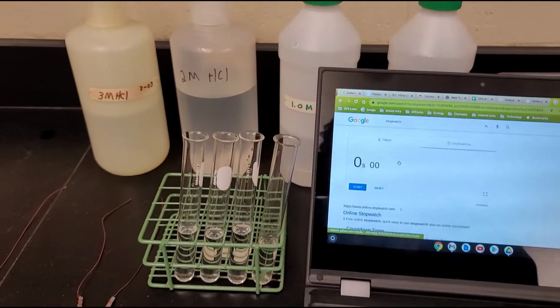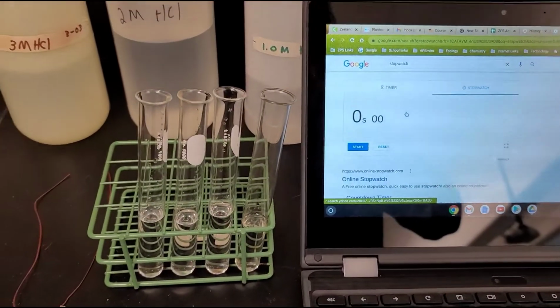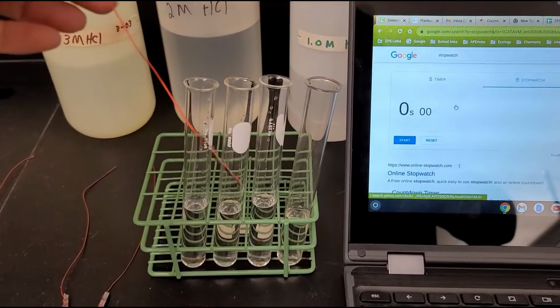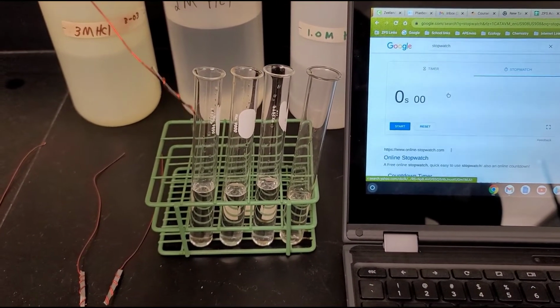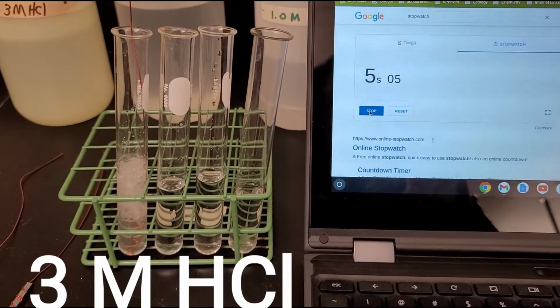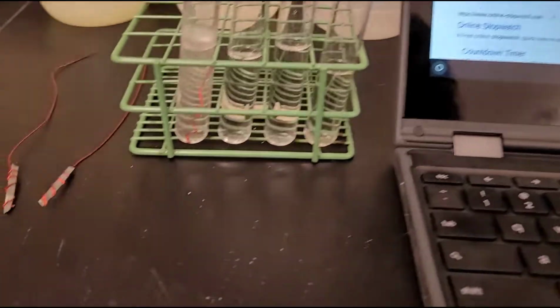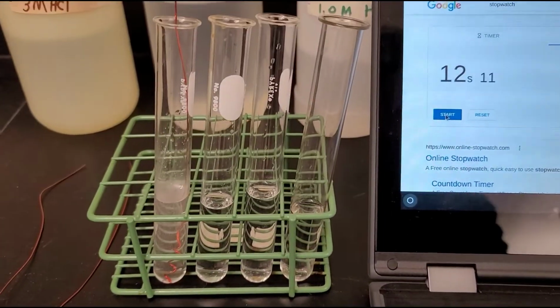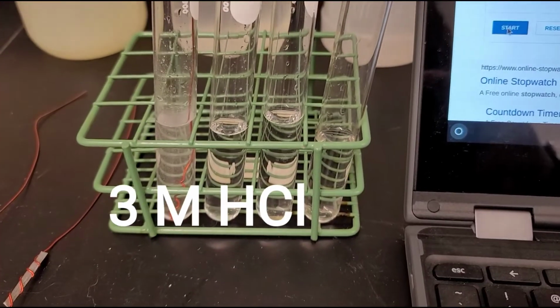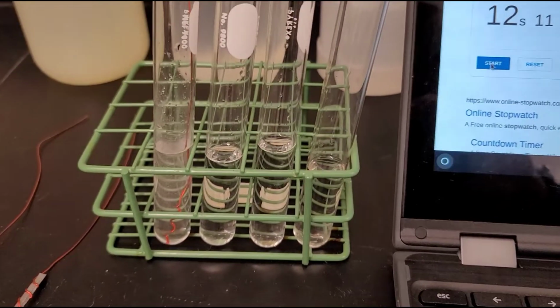Alright, so we're ready to go with our HCl and our acid, and I've got a timer here. So I'm going to pause my video so I can put my strip in and set my timer at the same time, and then I'll start the video again for you to see. Okay, so I've got my timer going on the Chromebook, and that is our magnesium strip. And I think it's done. So it's probably done a second before I said anything. So I would probably say that was 11 seconds there. Let's go ahead and do our next one.